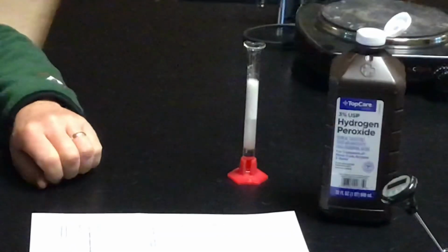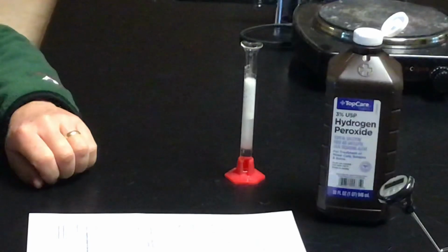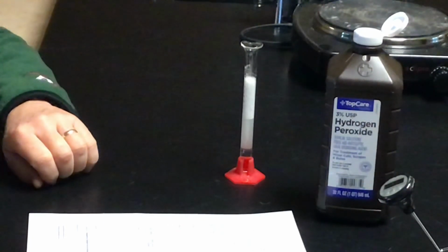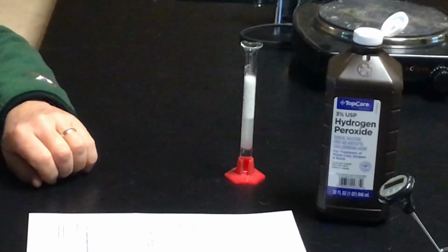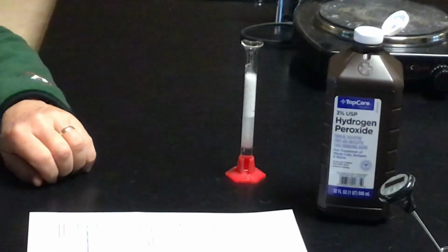It's not really showing any signs of maxing out yet. And we're at 9.7 so far. So I think in the interest of time, stop it at 10. Yep.